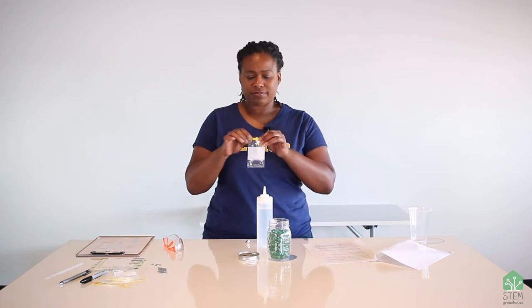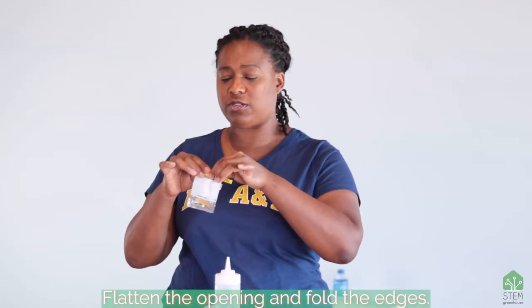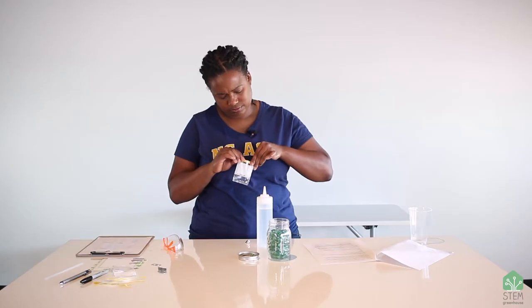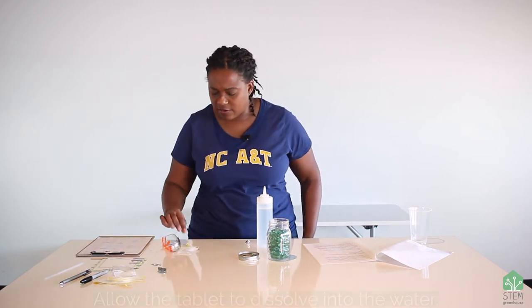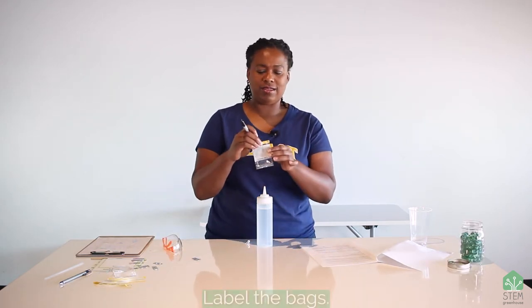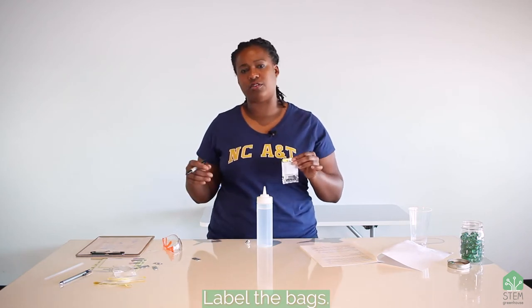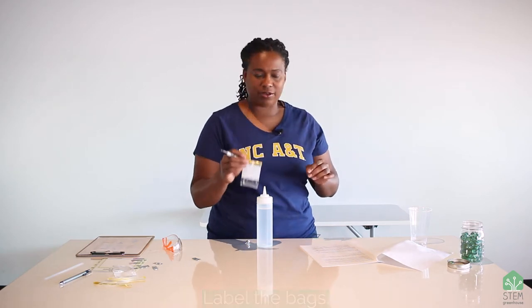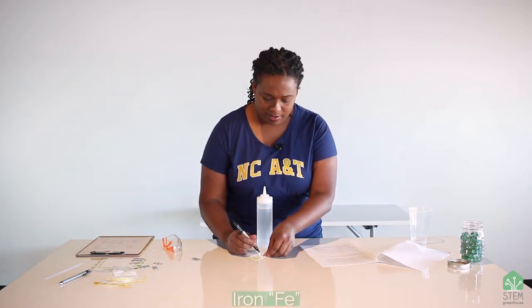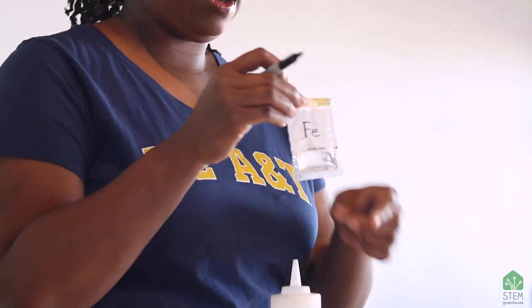To close this bag, the top tab is yellow. You're going to fold the top of the bag a couple of times — probably three or four times — and then close the edges. I'm going to leave it there for a second to let that dissolve. You will probably want to write the name of whatever chemical you're measuring for on the bag so that when you look back at all your results you'll be able to compare. This one is iron — the chemical symbol for iron is Fe.